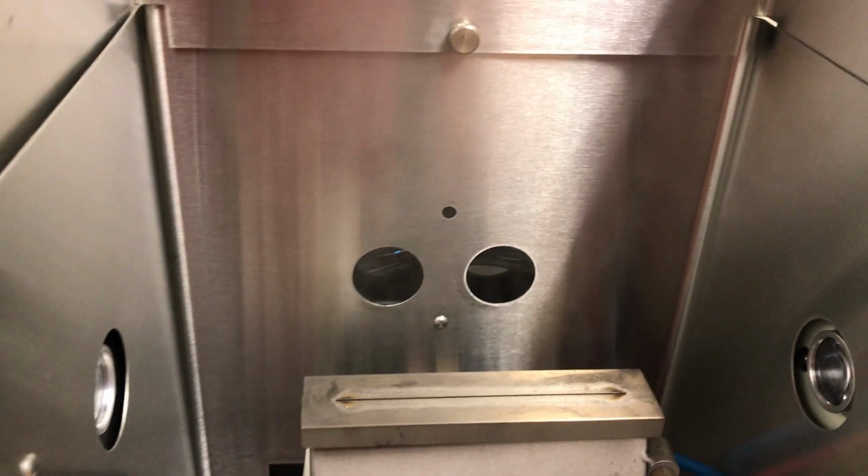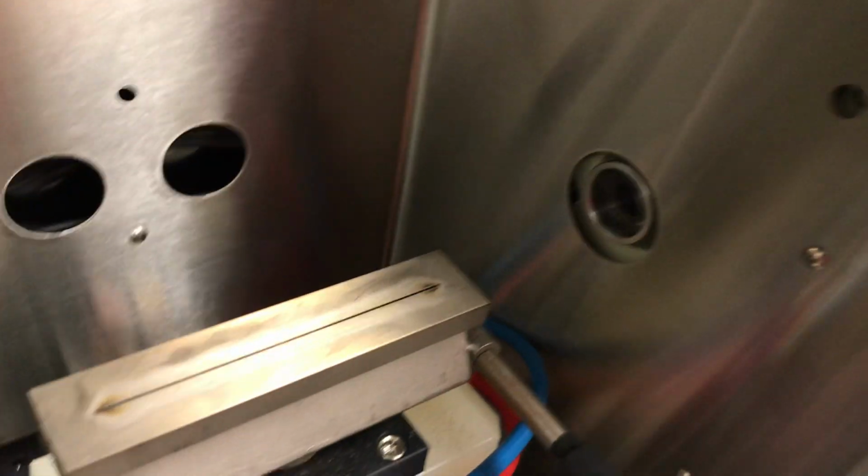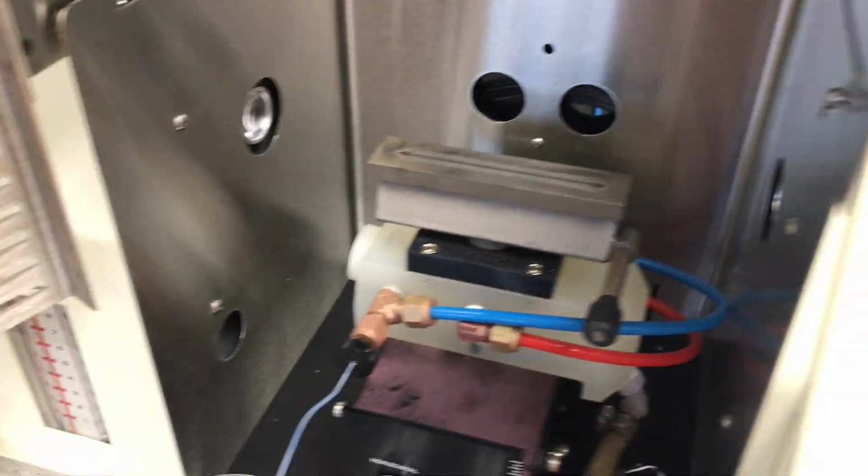Another way I can double check that is to turn the air back off, and I can come back to my card here and double check that it looks like I am centered with my beam coming straight down the slot burner. It looks like I am. So I think I've got good adjustment here. Alright, so I now have an aligned burner head.